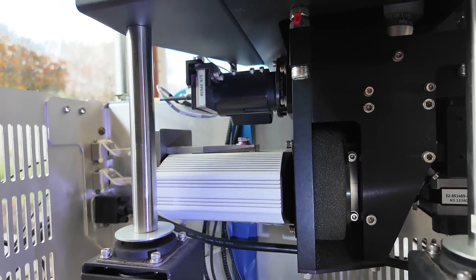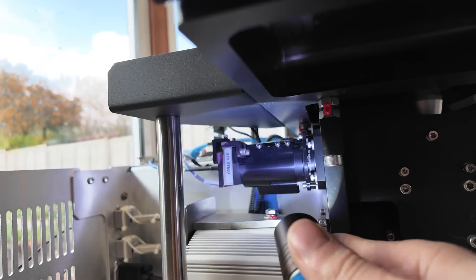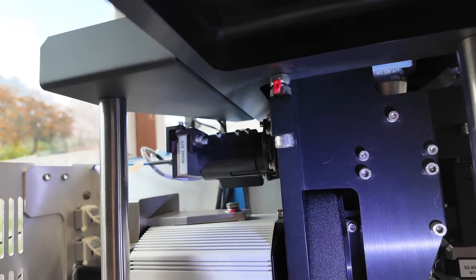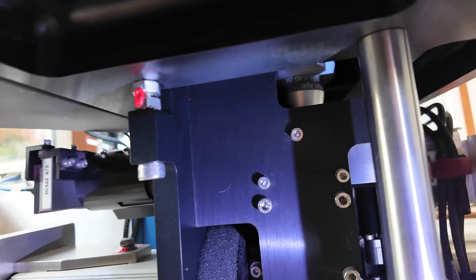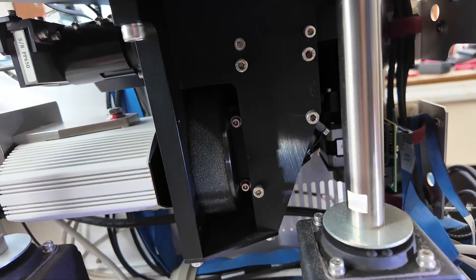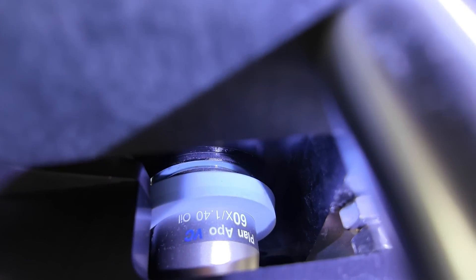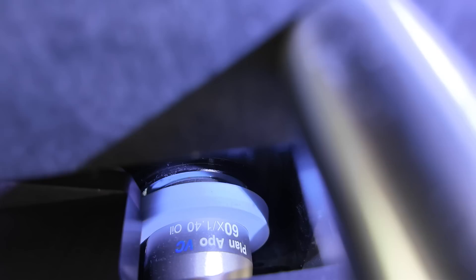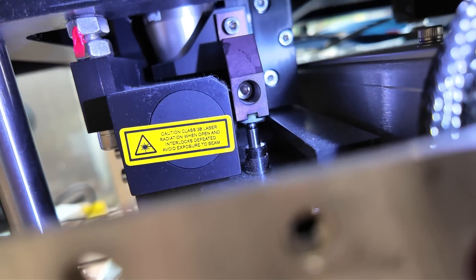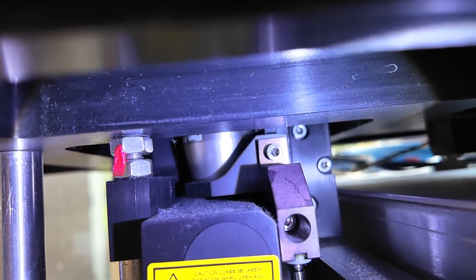So this is the optical block. We've got the camera over here. This is where the laser comes in through this fibre. I think there's a shutter mechanism and probably some other optics to get the beam in the right shape. Then there's a whole vertical section, a mirror down here, and some sort of mirror/beam-splitter arrangement to fire the laser up towards the subject. You can see the back of the objective. This vertical stepper I'm sure is for focus adjustment — it looks like it presses upward onto this assembly on the right to adjust the distance.